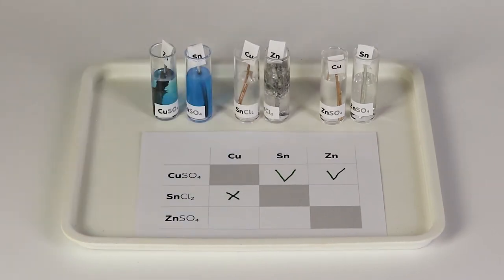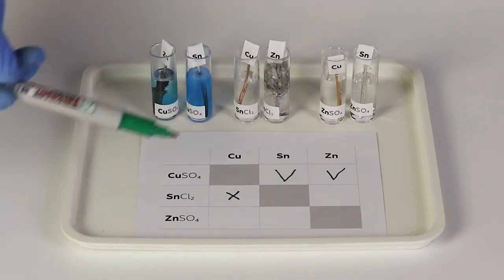As well, you will observe that there is no reaction in any of the other vials.